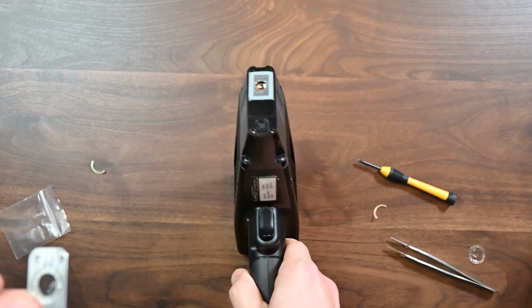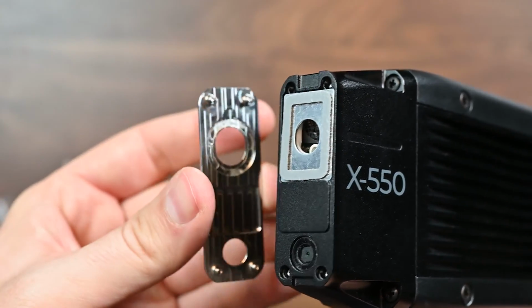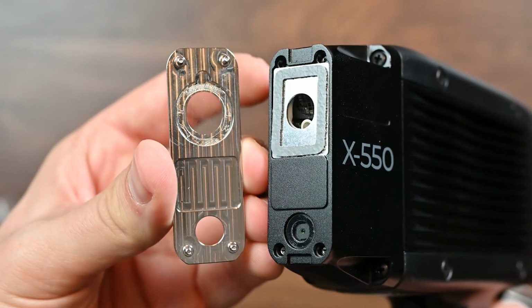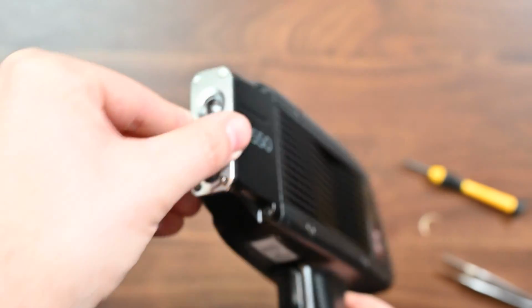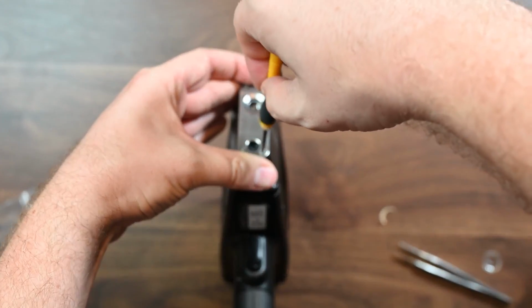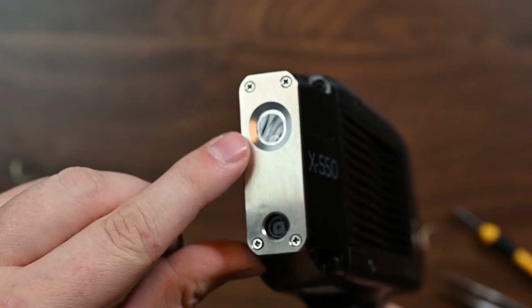So we're going to bring our XRF back in, and remember, we have those nice alignment features here, and the screws are already in our plate. So we're just going to put these two together. You can see that emboss and that indentation, the rectangle here. Put those together. It's going to kind of lock in place there. And then it's a matter of just putting those screws back in. And there you go. So now your window for your SciAps X-550 has been changed. You can see it there in the light.